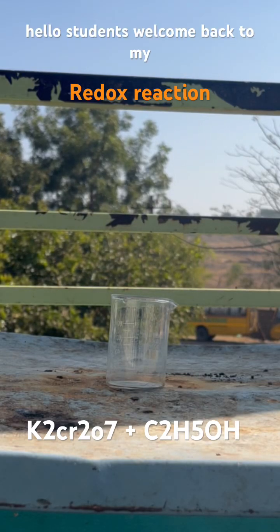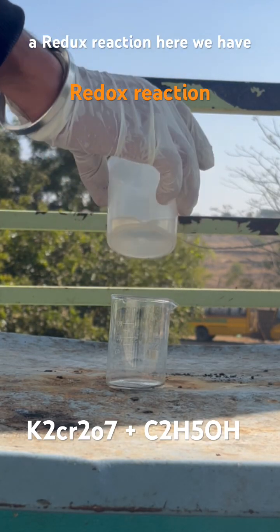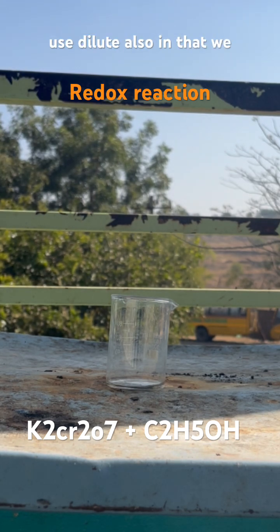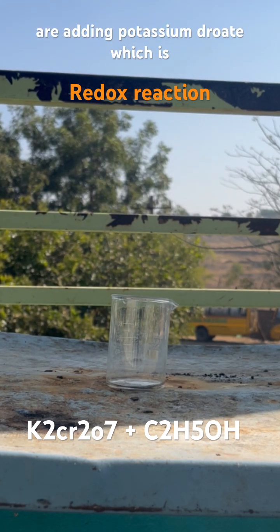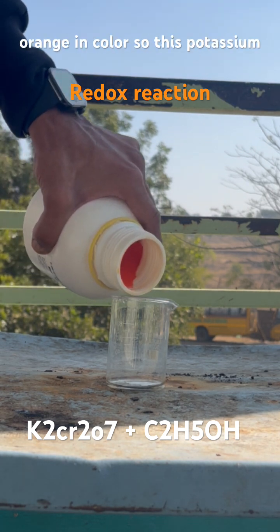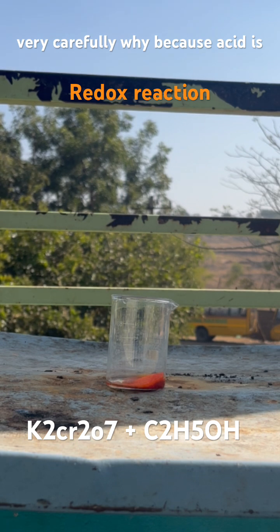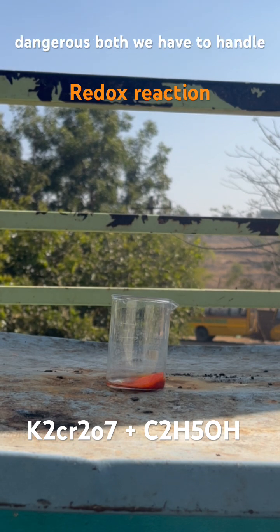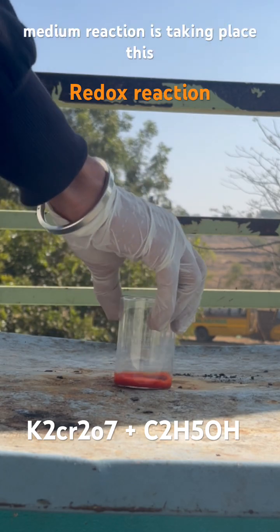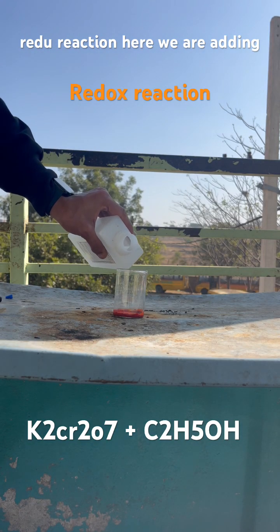Hello students, welcome back to my YouTube channel. Today we are performing a redox reaction. Here we have some concentrated sulfuric acid — you can use dilute also — and we are adding potassium dichromate, which is orange in color. We have to add this very carefully because acid is dangerous. Both chemicals must be handled very carefully. The reaction takes place in an acidic medium.